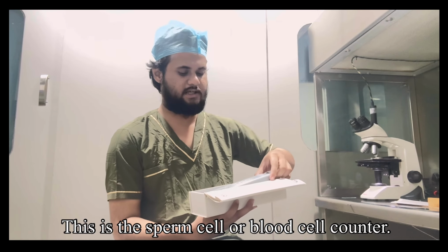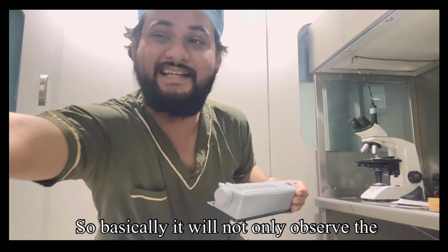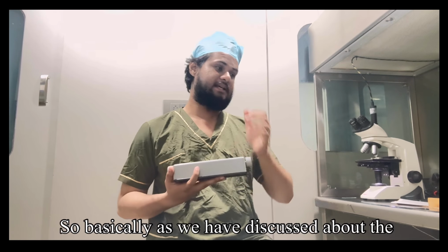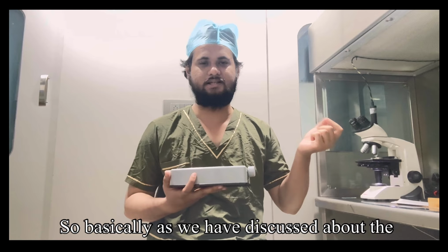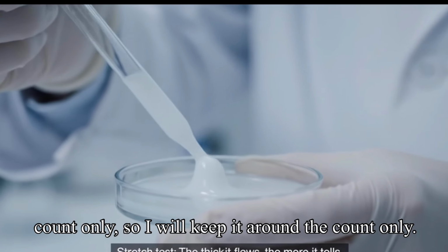So this is the sperm cell or blood cell counter. It is not only helpful for the count, it is also helpful for counting motility. As we were discussing the count only, I will keep it to the count.